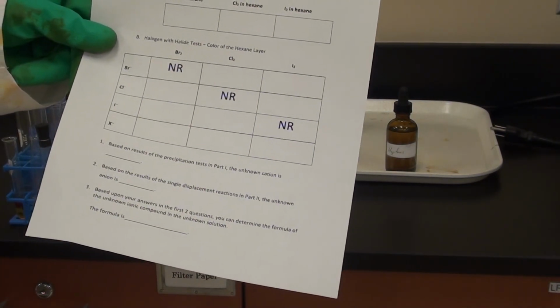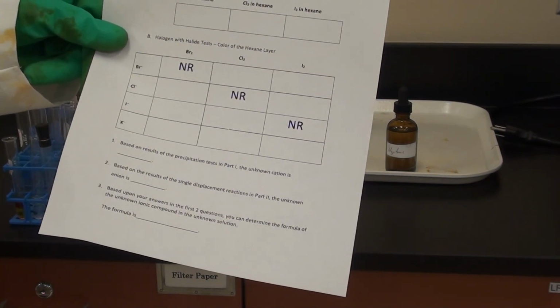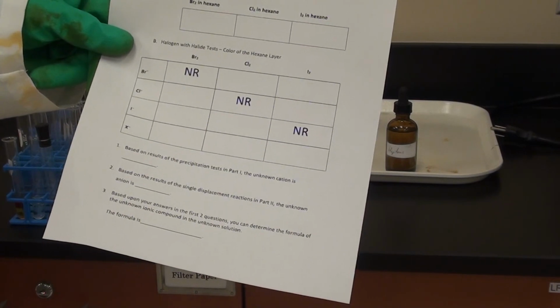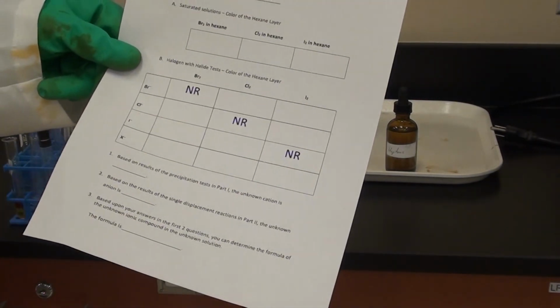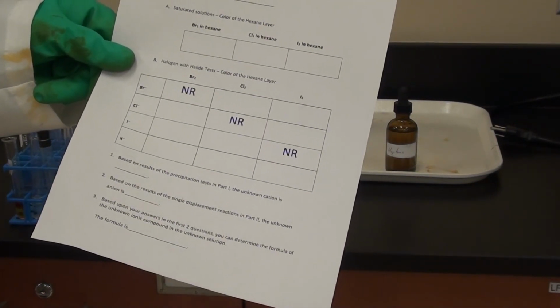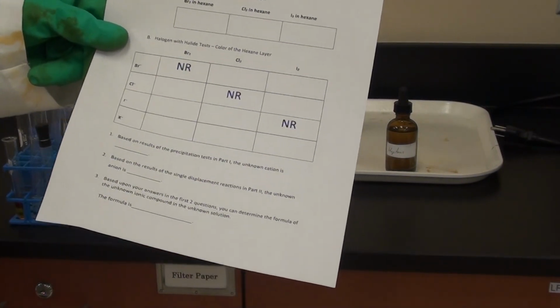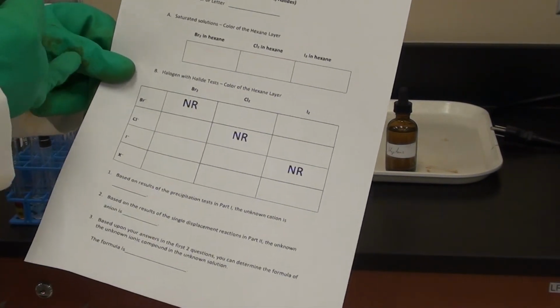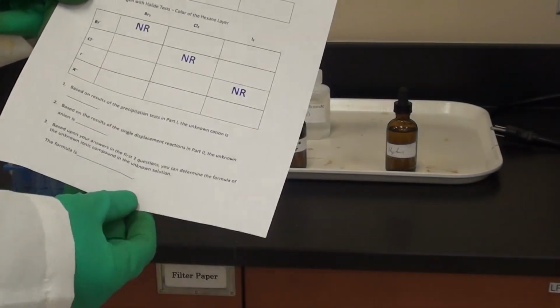Your cation will be one of magnesium, calcium, strontium, or what's the other one? Magnesium, calcium, barium. Yeah, barium, strontium, calcium, or magnesium. And so that's why it's important to use that same unknown. Right. So if you pick unknown number 1 for part A or for part 1, make sure you use unknown number 1 for part 2. Yeah. Just be consistent with whatever you choose. That's great.